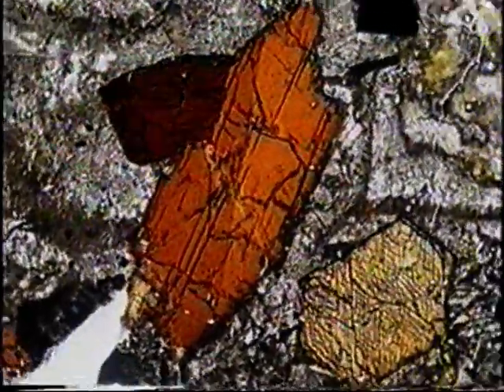Hornblende can be brown as well as green or greenish-brown. Pleochroic colours vary from yellow to dark brown. Other properties are as for green hornblende.